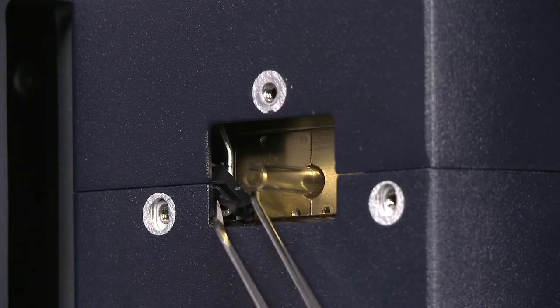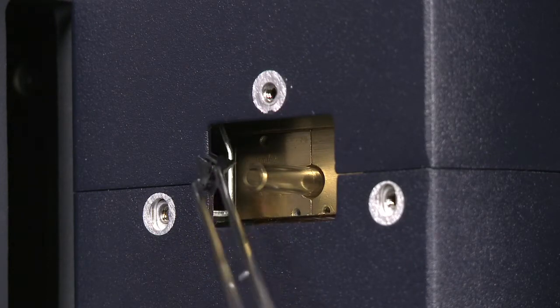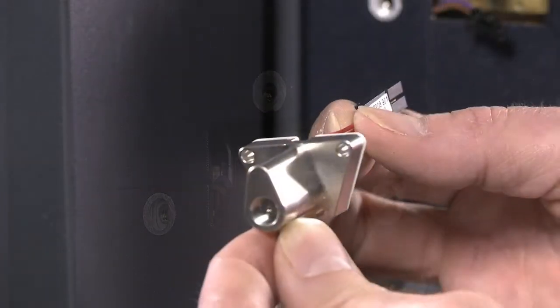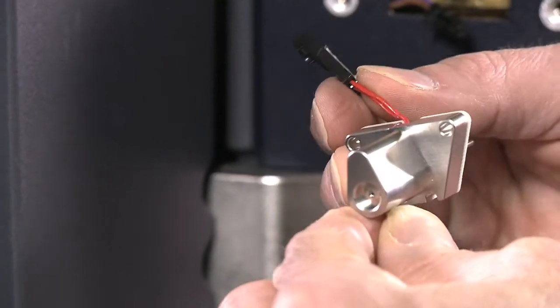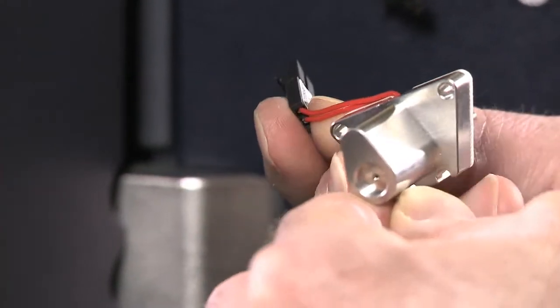Locate the heater wire harness, which will be tucked inside the furnace cover, and gently pull it out. Now locate the plug heater and insert the heater element into the hole in the Mass Spec adapter fitting.